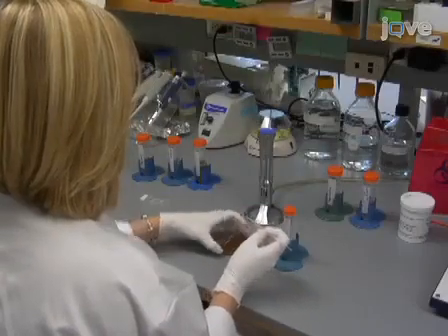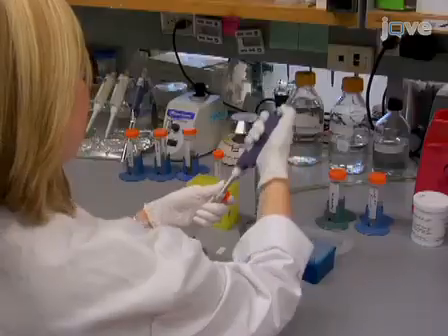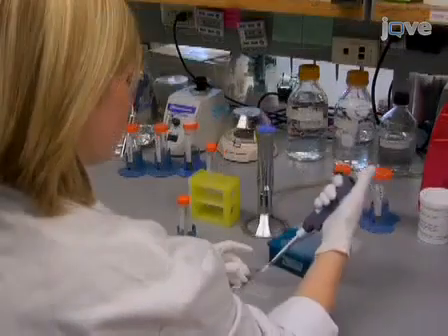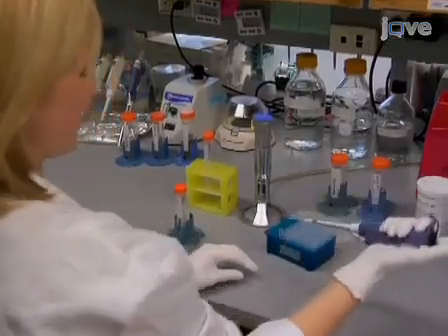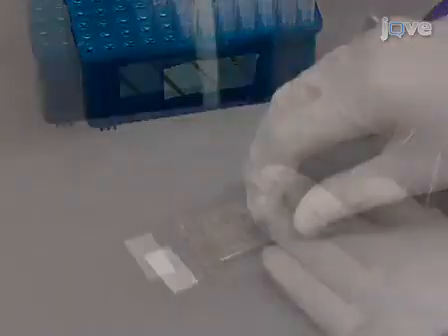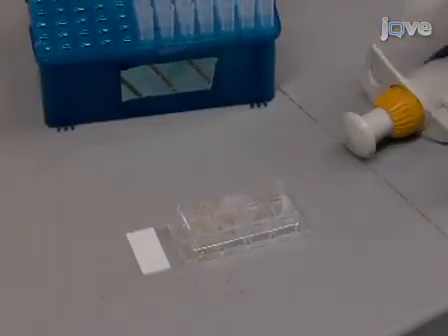Inoculate bacteria in liquid culture medium and incubate the culture until it reaches mid-log phase. Dilute the mid-log phase suspension at 1 to 2500 in pre-warmed medium for non-typable Haemophilus influenzae, which is being used in this example. This will provide 40,000 colony-forming units per milliliter as a starting concentration. Aseptically transfer 200 microliters of diluted culture into each well of a sterile 8-well chamber slide.